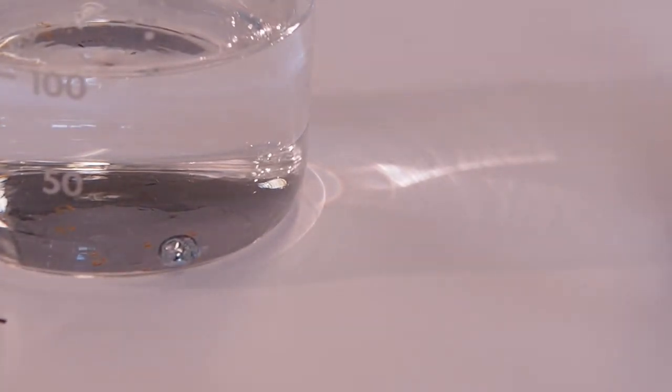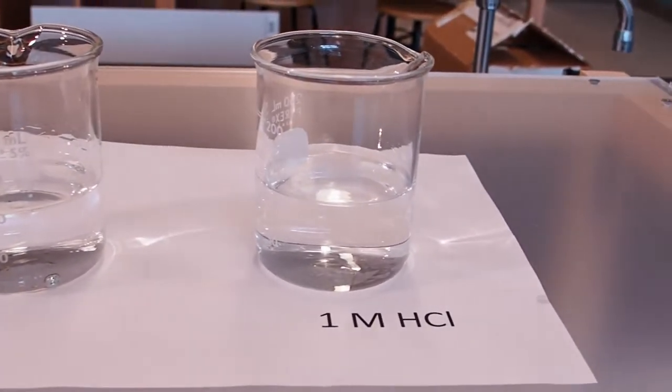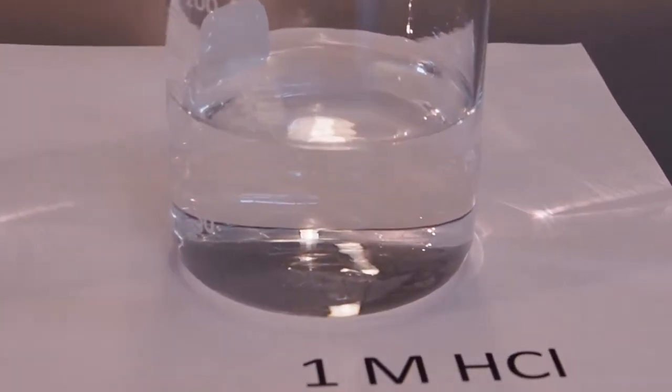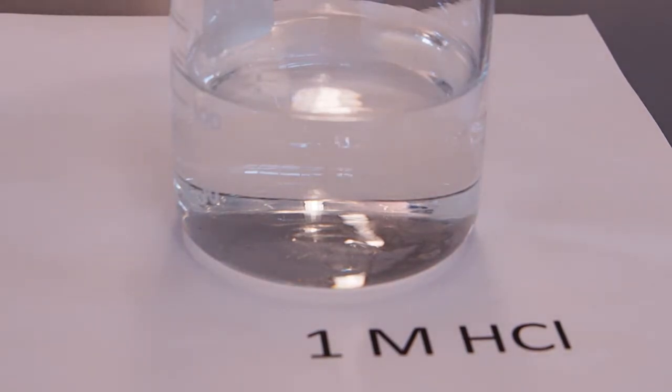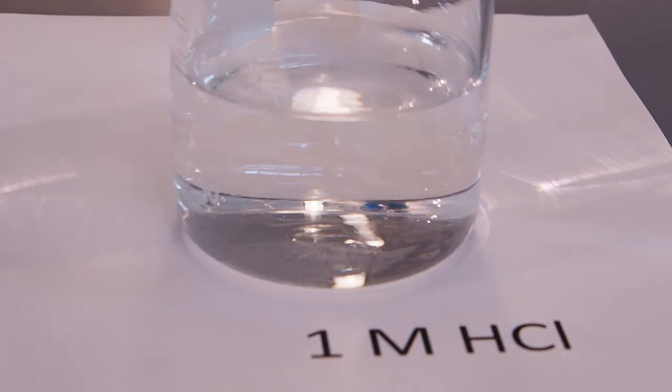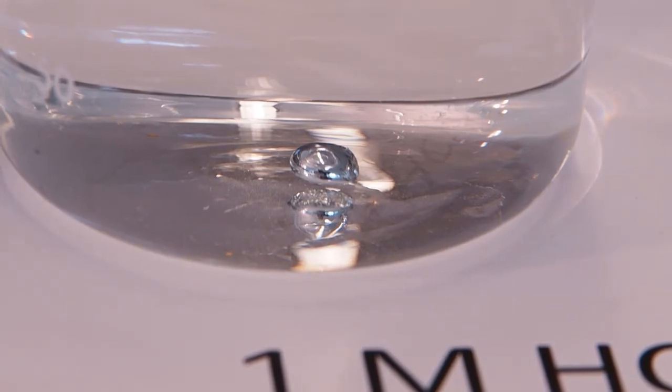Sitting there, not reacting. Okay, well now, then, try putting an ingot into HCl. One molar hydrochloric acid. And truth in advertising, we're using the same ingot. Okay. We can see the ingot and its reflection, actually, below it, and it is not reacting in HCl. So we left that for a while, and it's not doing anything. So next, we'll try nitric acid, and we'll do that in the fume hood.